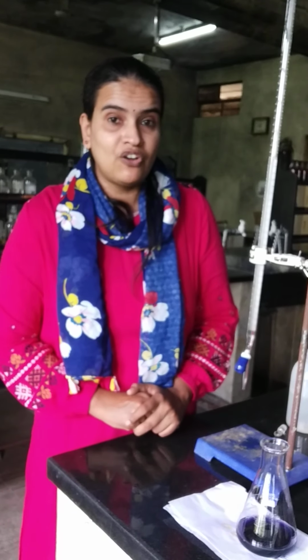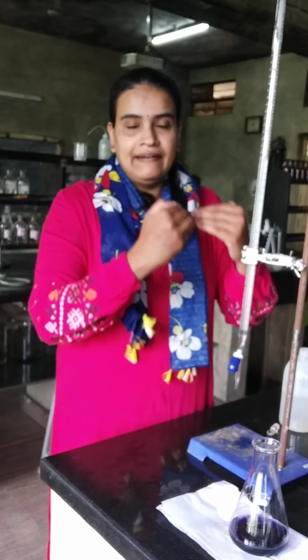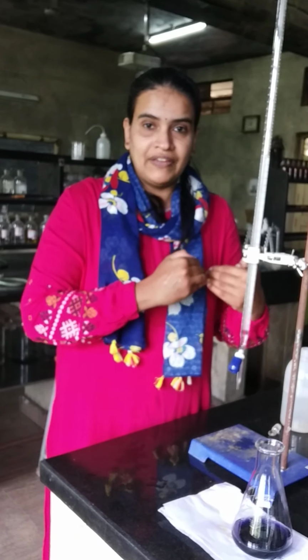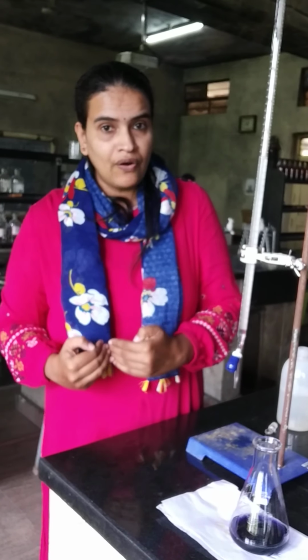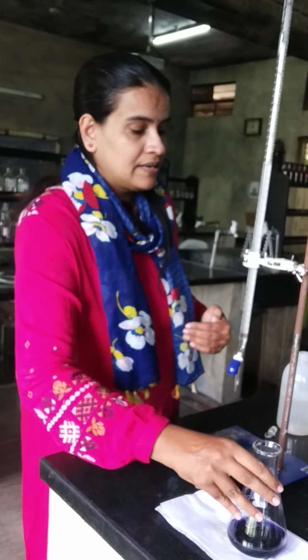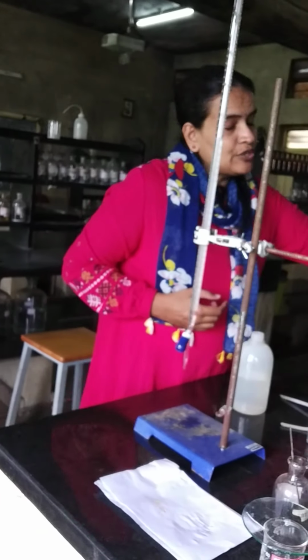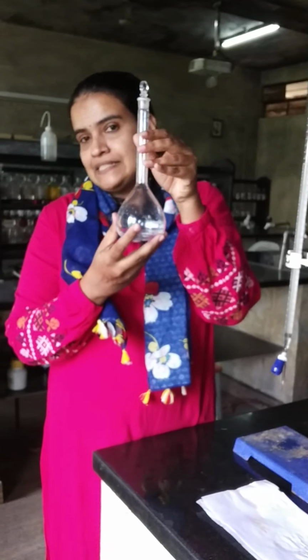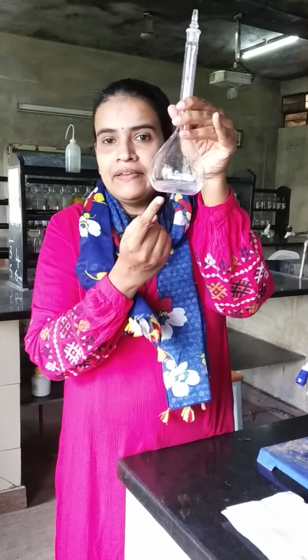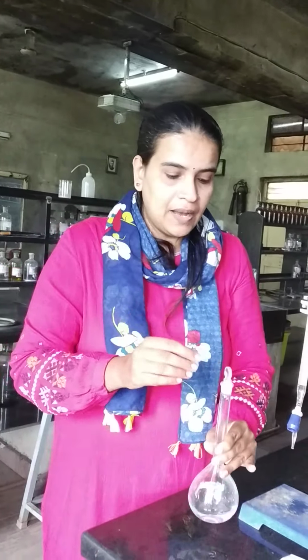Coming to the second part of the experiment, which is estimation of the given zinc sulfate solution. Zinc sulfate and EDTA. In the first part also zinc sulfate and EDTA. That is the prepared zinc sulfate. This is the unknown zinc sulfate. So second part, for the estimation of zinc sulfate, the solution will be given in a 250 ml standard flask, little bit solution would be given. So this solution is the unknown solution. This we have to make up first.